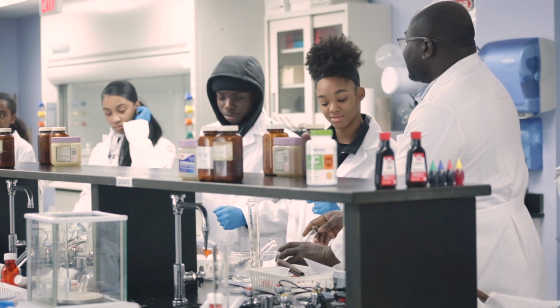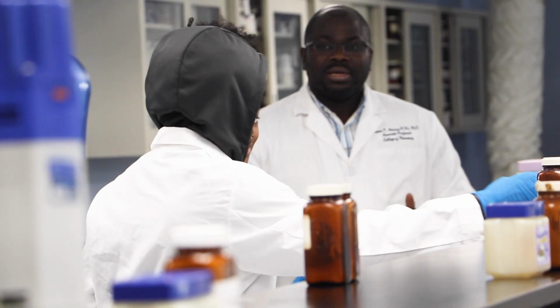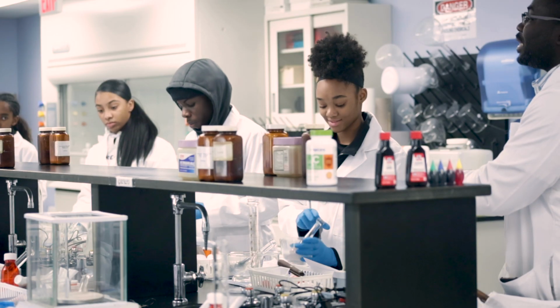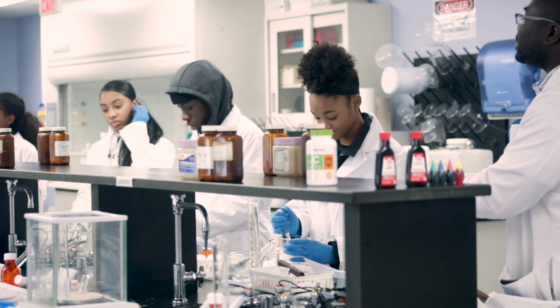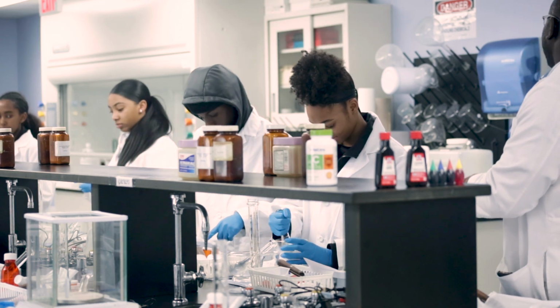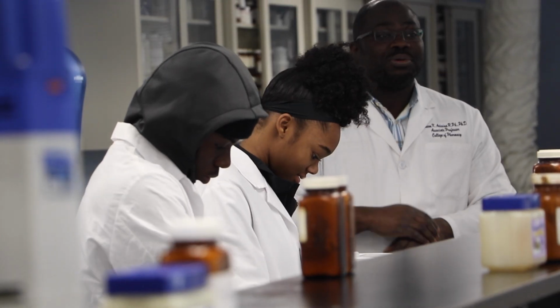Why is that important for your ointment? If you don't do that, it's going to be gritty. When you rub it on your skin, you're going to feel particles rubbing on your skin. You won't like it. So if I made this for you and you came to my pharmacy to buy stuff and I gave you this, would you be happy?